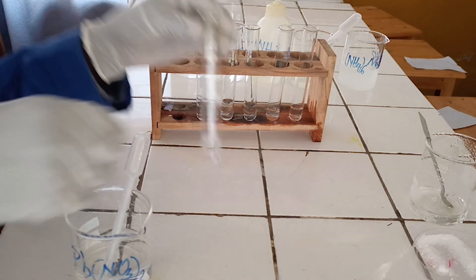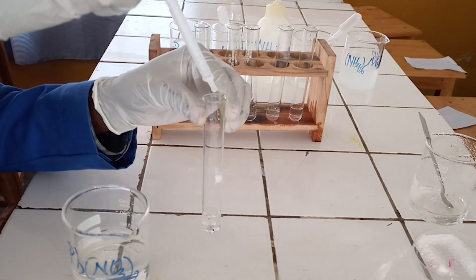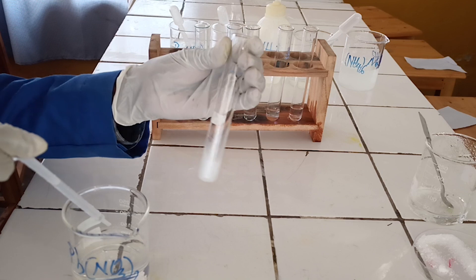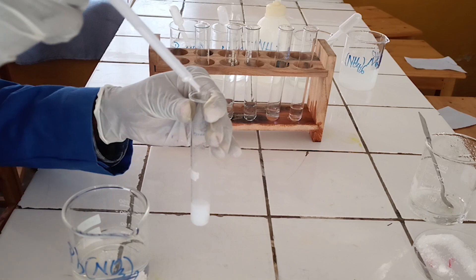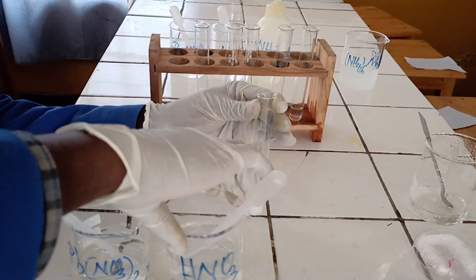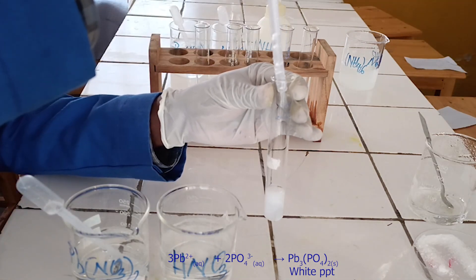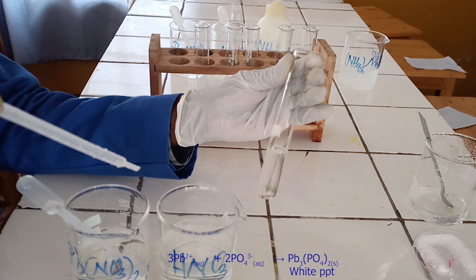To the first test tube, add a few drops of lead nitrate solution followed by diluted nitric acid. As you see, lead nitrate reacts with phosphate ion to form a white precipitate. The precipitate formed is soluble in nitric acid. Below, there is the ionic equation for this reaction.